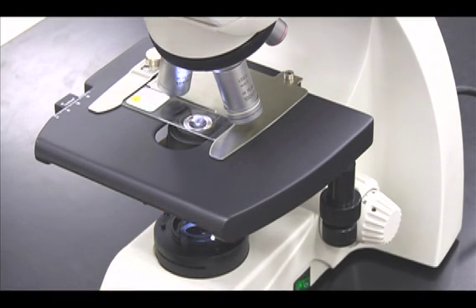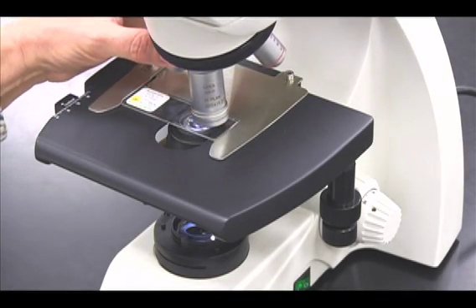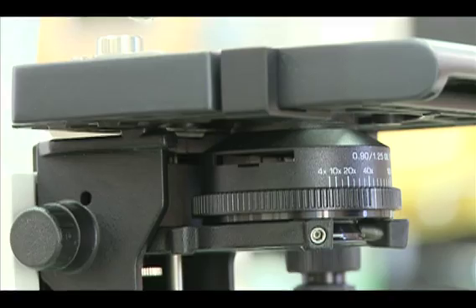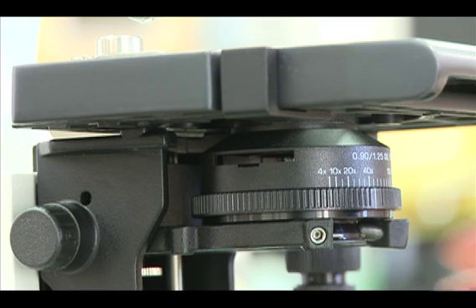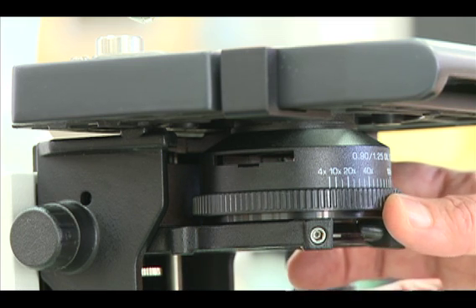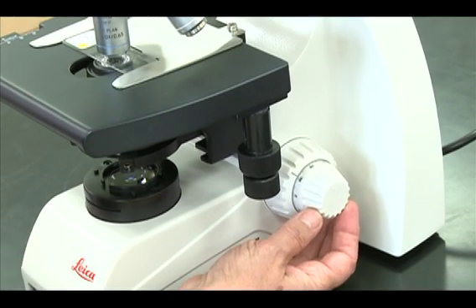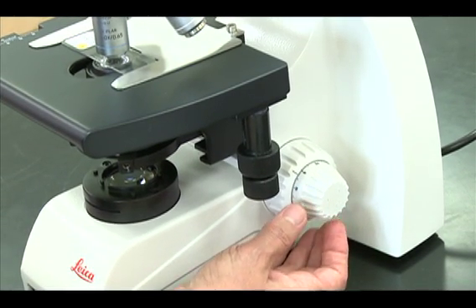Carefully rotate the 100x objective into position and set the iris diaphragm ring to 100x. Focus with the fine adjustment knob and scan your slide.